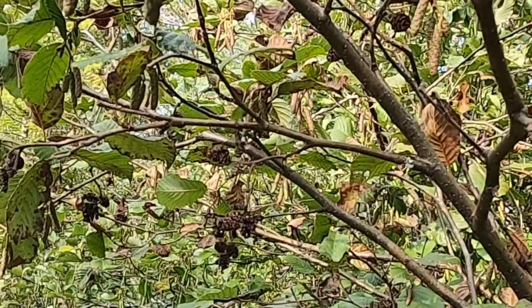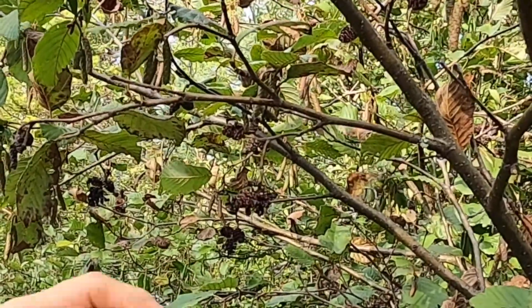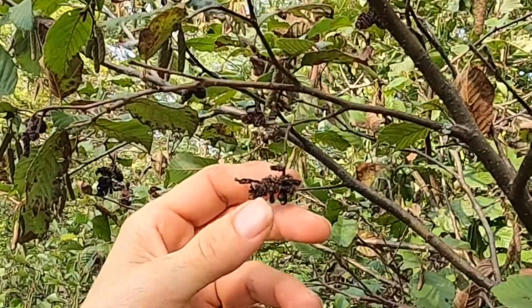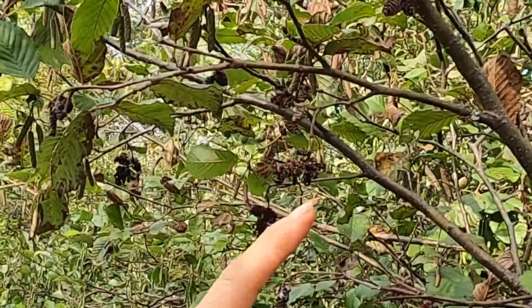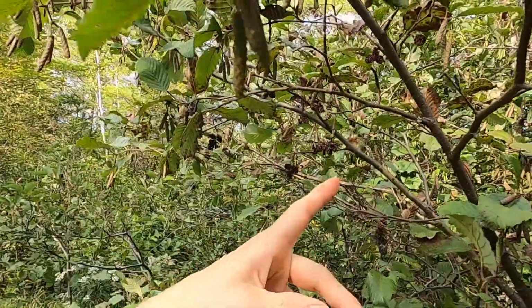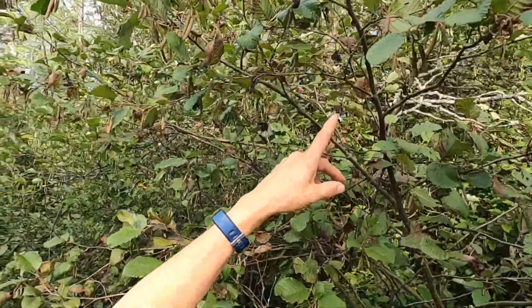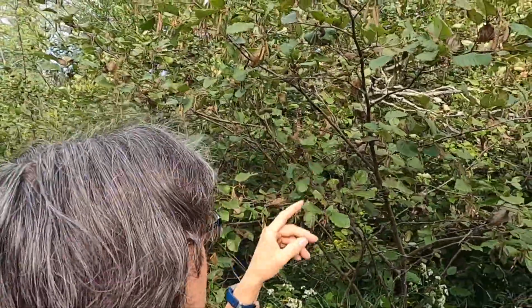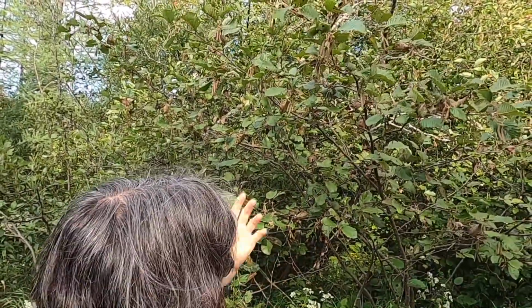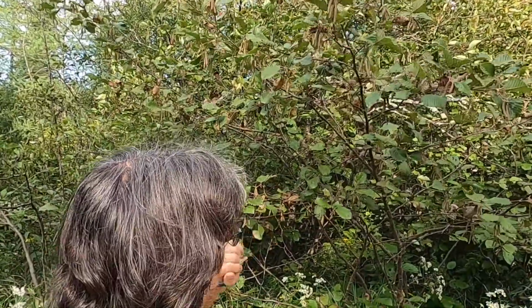Here's another example of an ascomycete that I wanted to point out that's talked about in your lab handout. So there's a photo in the handout. This is the alder tongue gall, and it is these structures, these tongue-shaped structures that are growing out of this cone-like structure. So an alder is a flowering plant, so this is not an actual cone, but this is the female part of this plant where the eggs would be being produced. And that is the only place on the alder where the tongue gall will actually form its fruiting body.